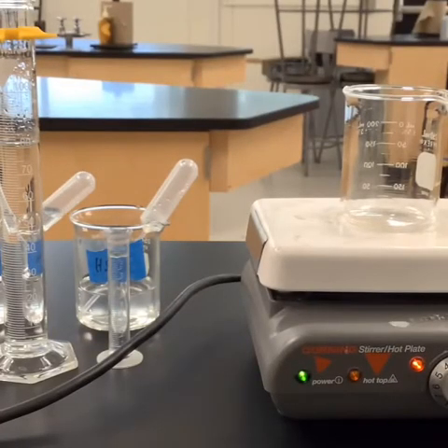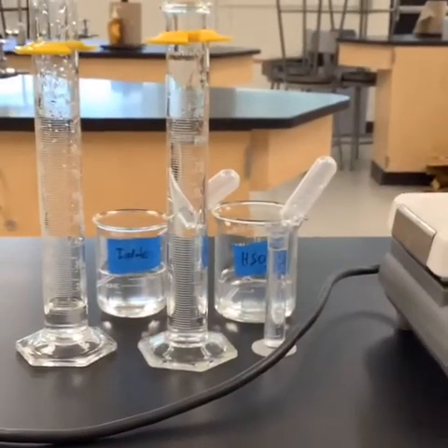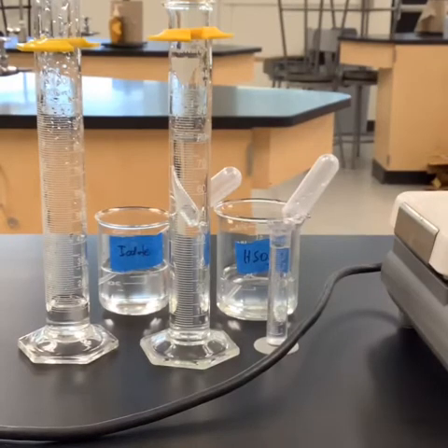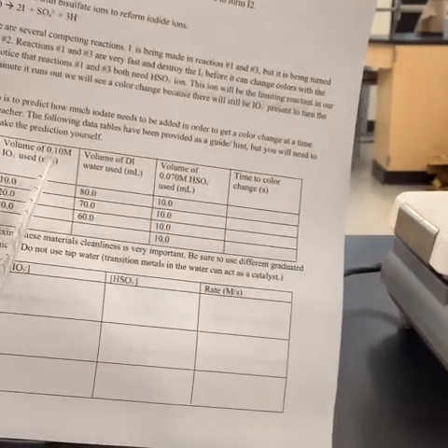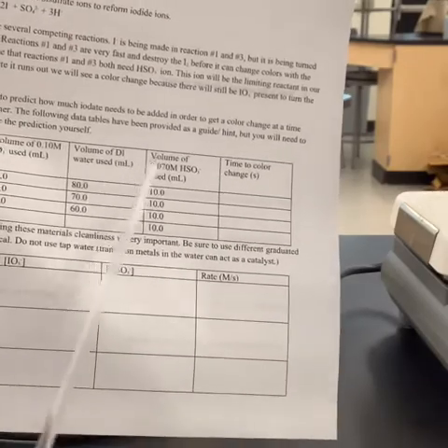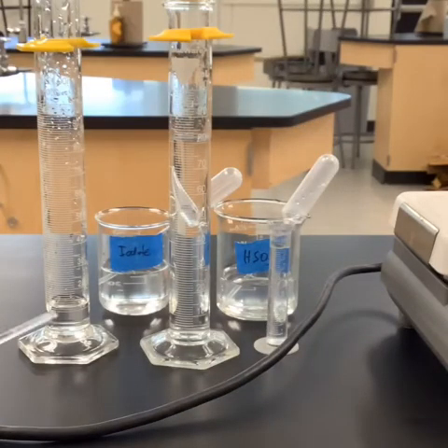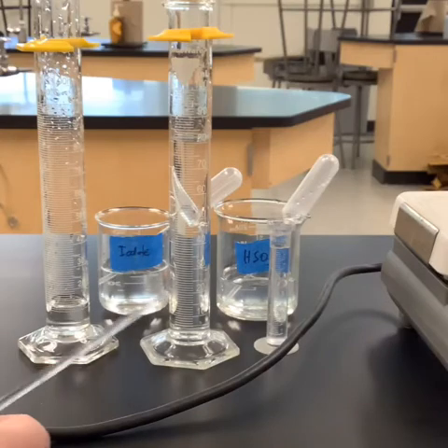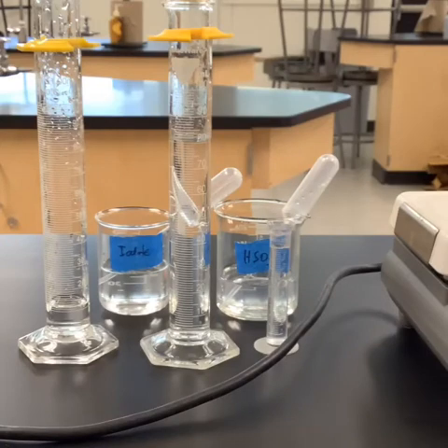Okay, so we are ready to get started here. I've got our first set of information ready to go. Basically, if we slide the camera over just a little bit, we can see the different chemicals that I have out and ready to go. Remember that our mixing table tells us that we need 10 milliliters to start with the IO3, we need 80 of the distilled water, and we need 10 of the bisulfite. So when we look over here, I've got the 10 of the iodate, I have the 80 of the water, and then this one is 10 of the HSO3 minus.